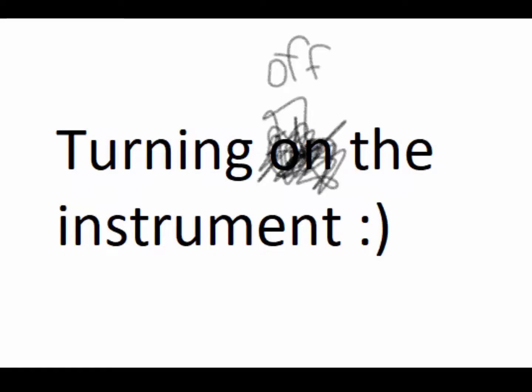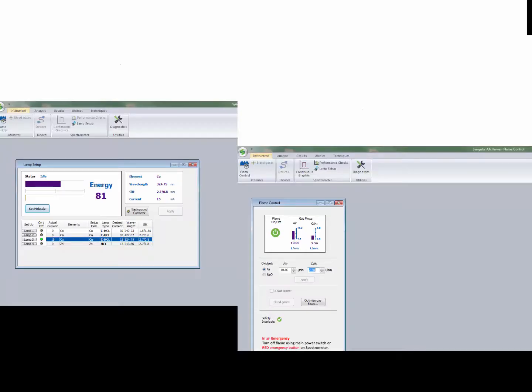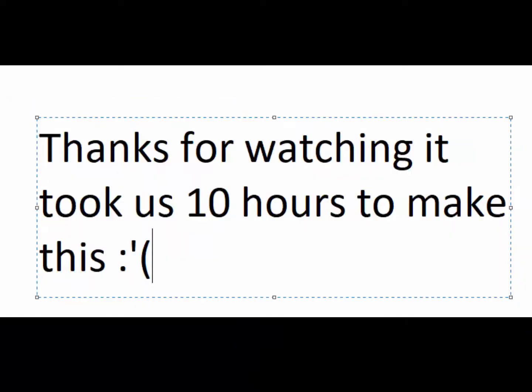Turning off the instrument is like turning on the instrument, but backwards. So anyway, first turn off the flame in the lamp, then you can exit the program, after which you can turn off the instrument by the power button that's under the lamps, and then finally close the acetylene tank and turn off the fume hood. And don't forget to record the pressure of the tank in the logbook.